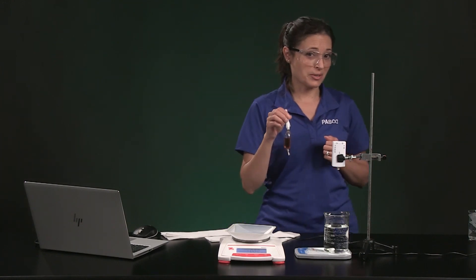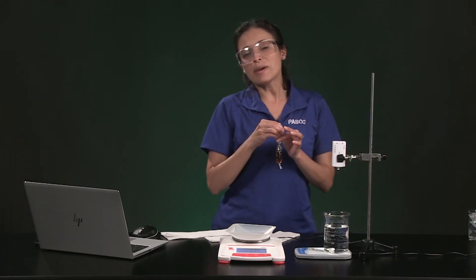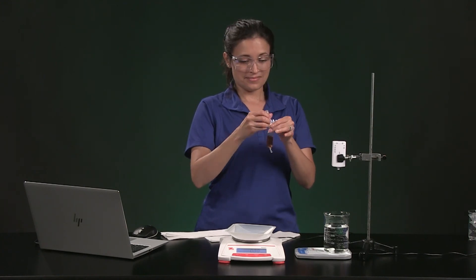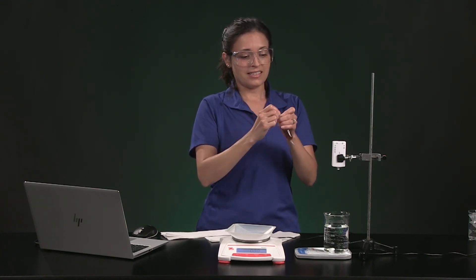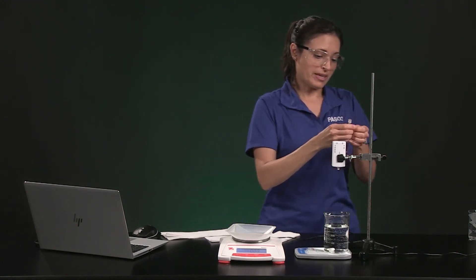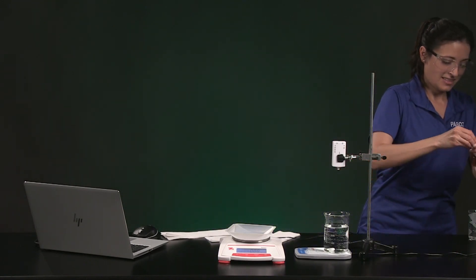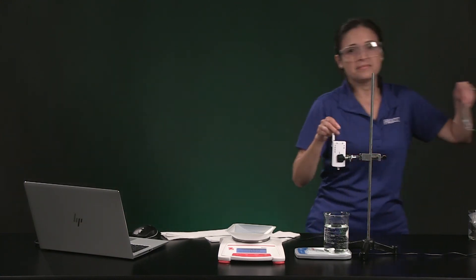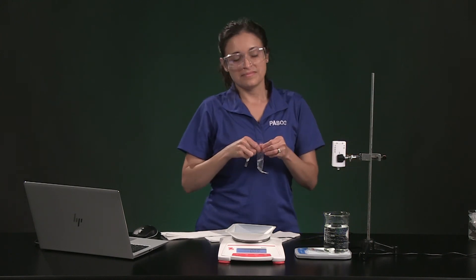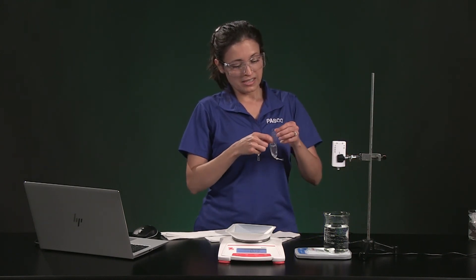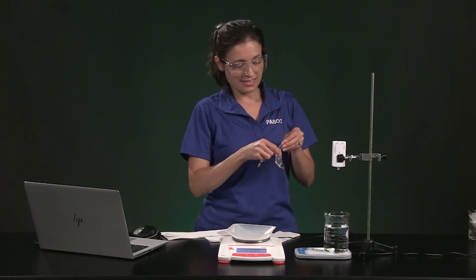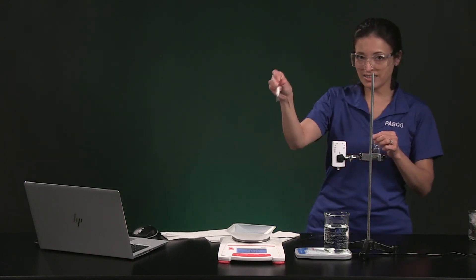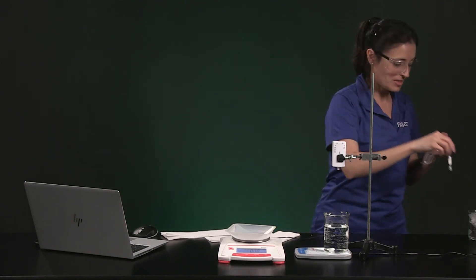And now we are going to do another run with just distilled water in the bag so you can see how mass and pressure compare when there are no solutes inside the bag. So I need a second to take off this older bag with the syrup in it. And I have the same volume of distilled water in this bag.